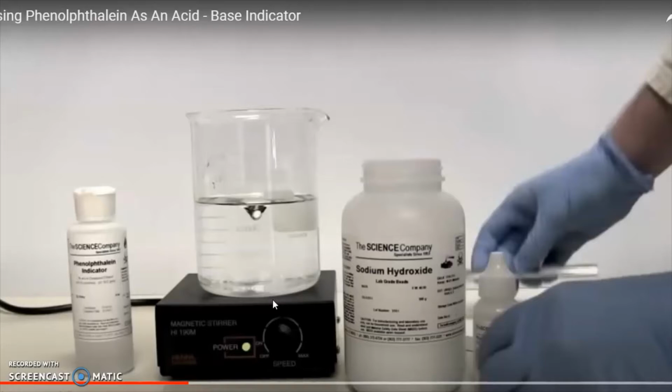So an indicator is just a chemical, and specifically it's a chemical that changes colors depending on the pH of the solution that it's in. There's a lot of different kinds of indicators, and they change color at various different pHs. So I'm going to show you just a couple. This particular indicator is called phenolphthalein.